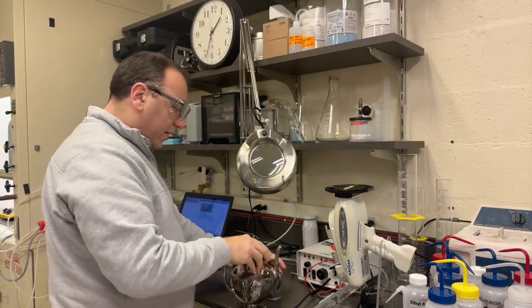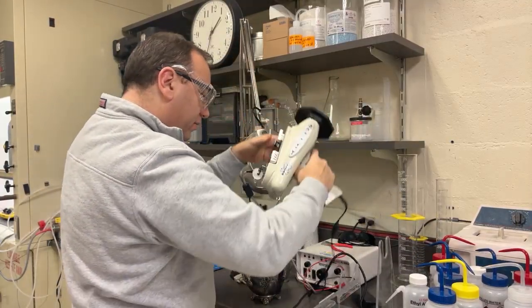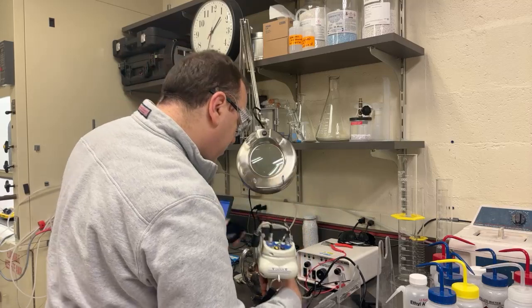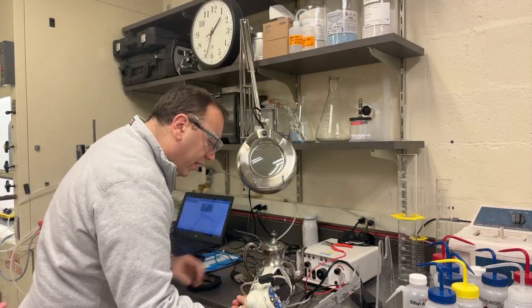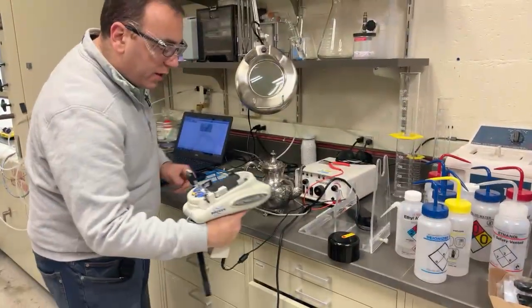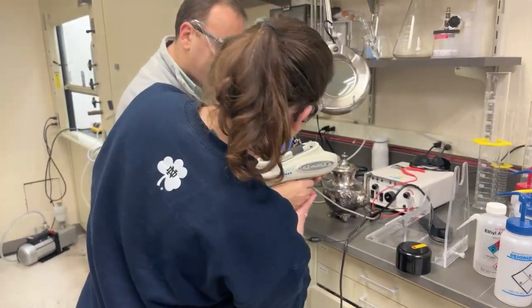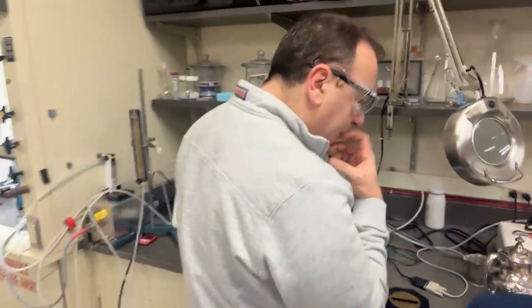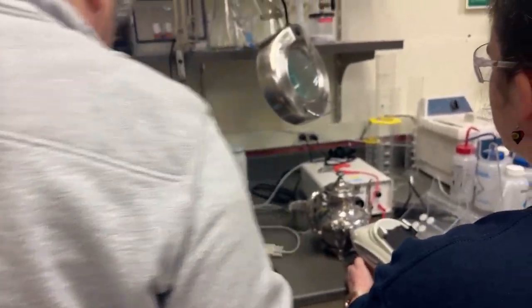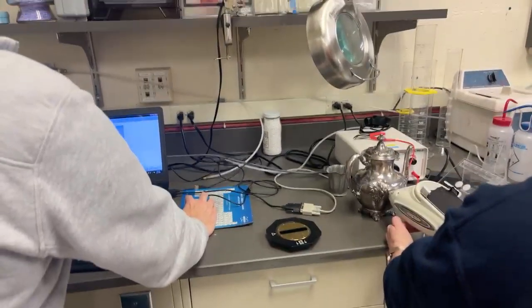Okay, let's do it a different way. I could grab a different thing from the same set. Hopefully they're all made out of the same elemental admixture. Can you hold this for a second? Yes! Like this. I get to hold it? Yep. Cool. Do I pull a trigger? No, I would do it from the computer. So I just hold it as close as you can, and still, just still for 10 seconds. So I'm starting.